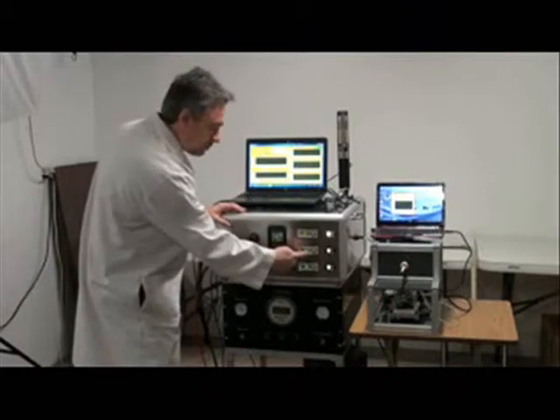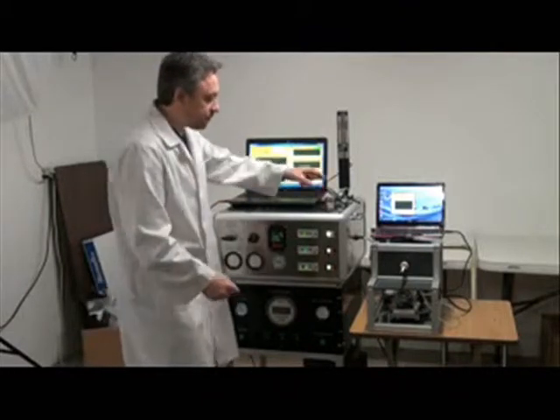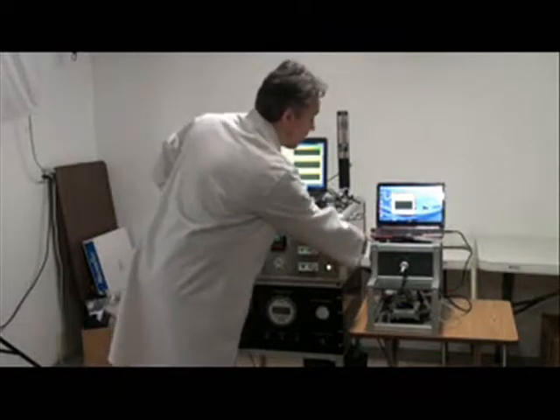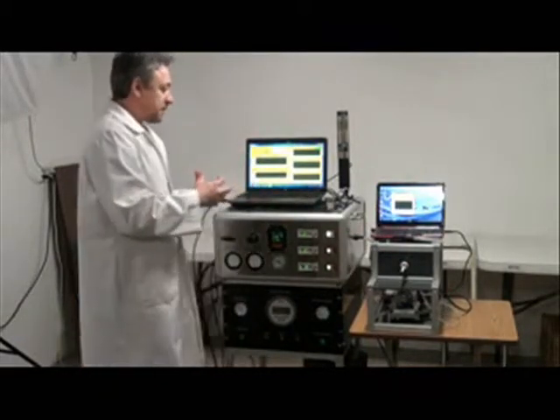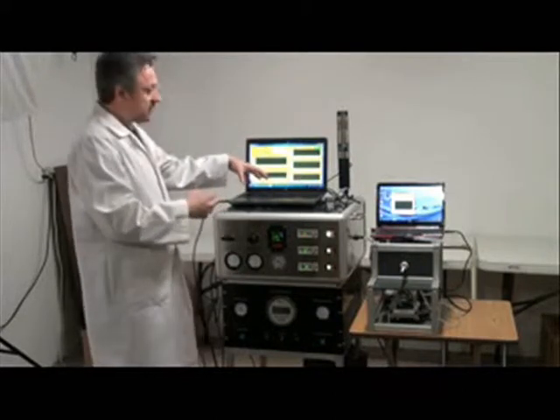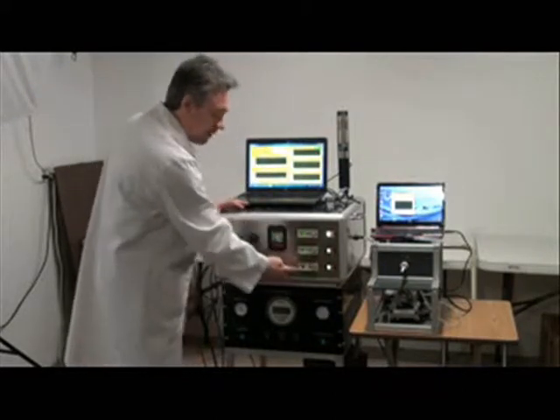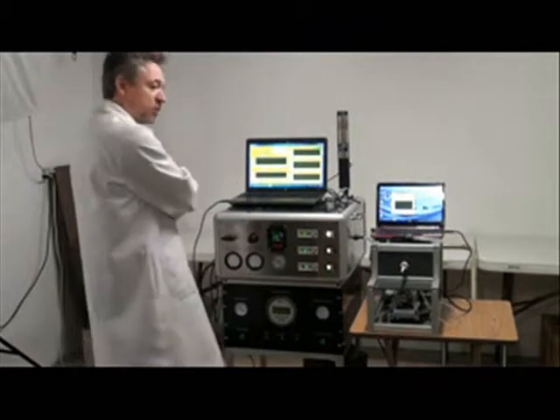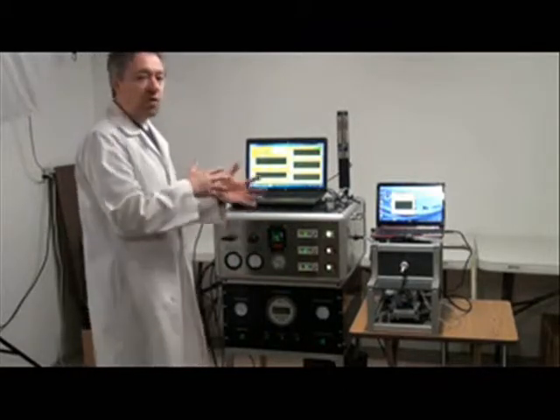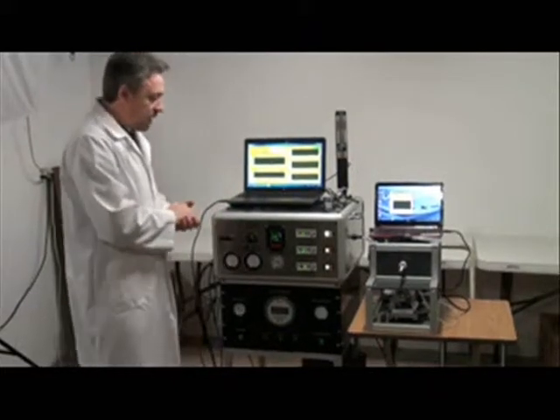We have some pre-dilution air going in and mixing with mainstream smoke coming from the smoking machine. After that pre-mixing, it goes into another mixing vessel where we apply the main dilution air that is going to be needed for the downstream application, be that an in vitro or an in vivo exposure.